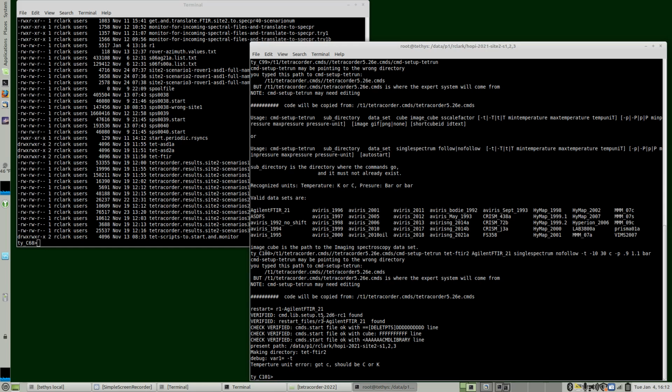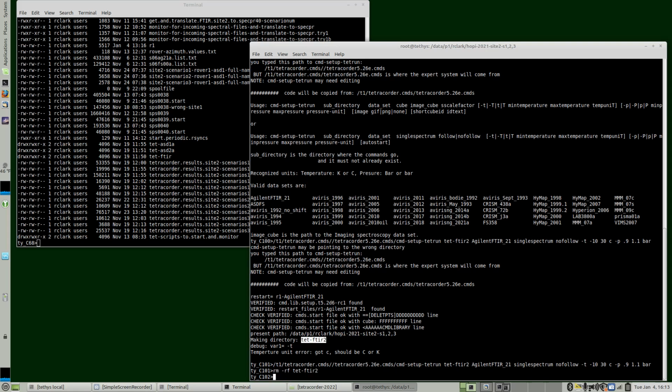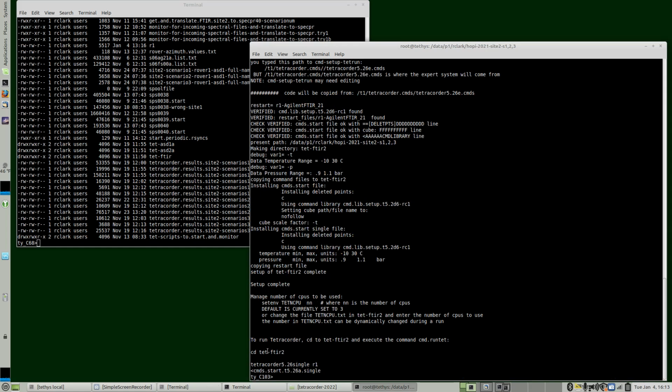And it didn't like one thing, so what did I miss? It made the directory. Oh, it needed a capital C. Okay, so that's easy to correct. It made the directory, which we have to remove. So we'll start over here. Capital C. Good, now it worked. CD. Well, actually, we can do the run right here.